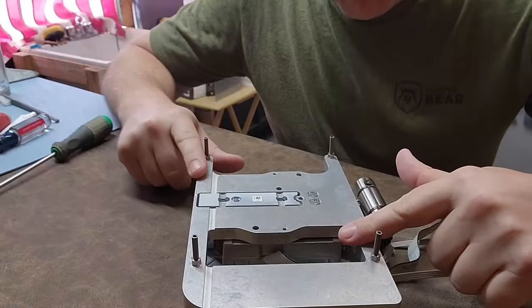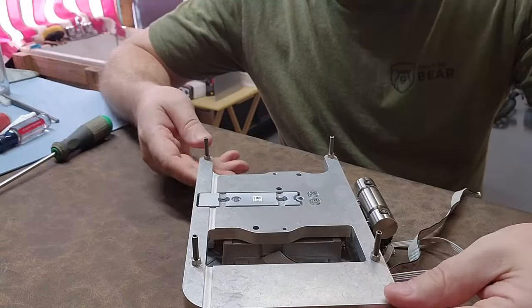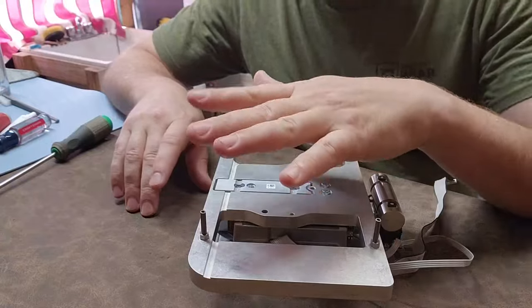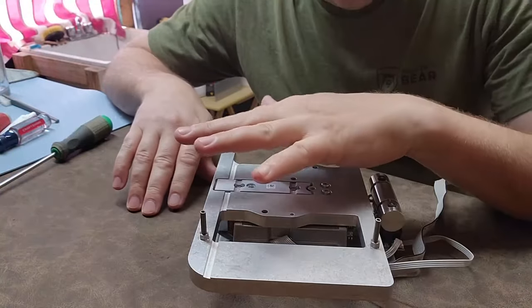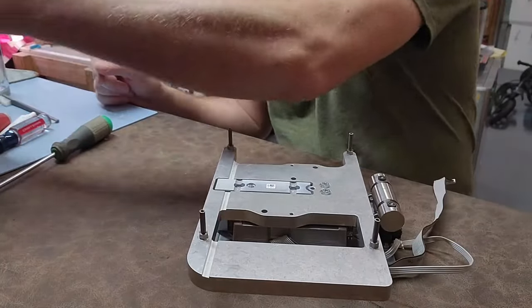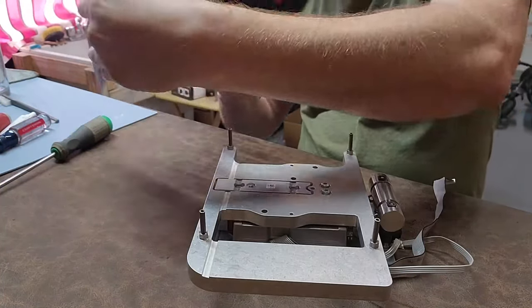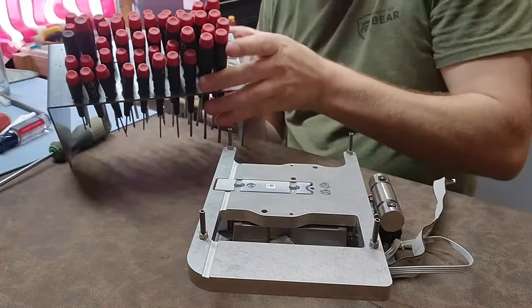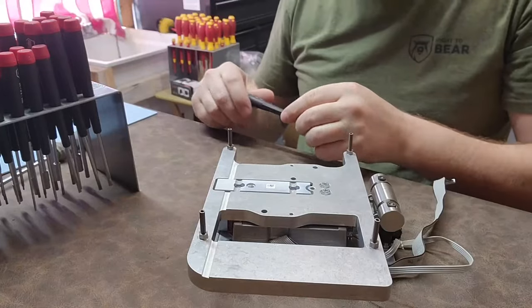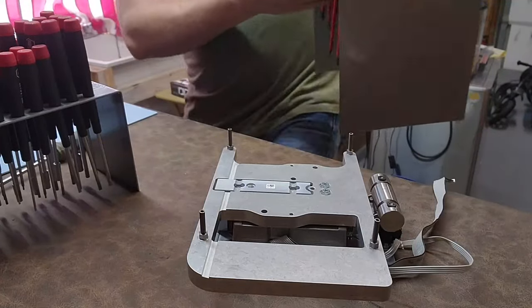The first thing we've got to do is get rid of this platform. It's probably heavy for continuity — you don't want the weight bouncing around, so you have to have quite a bit of preload, which is why this guy has a lot of mass. Let's see if I have the correct torx to get this off — looks like I need a bigger one.